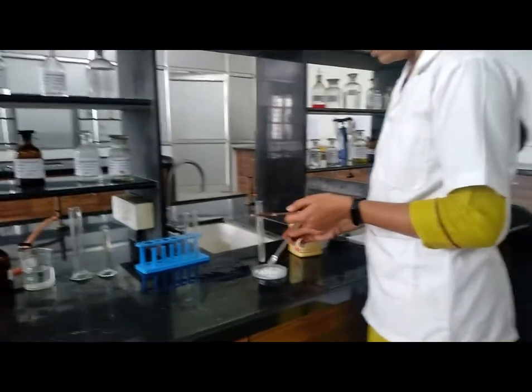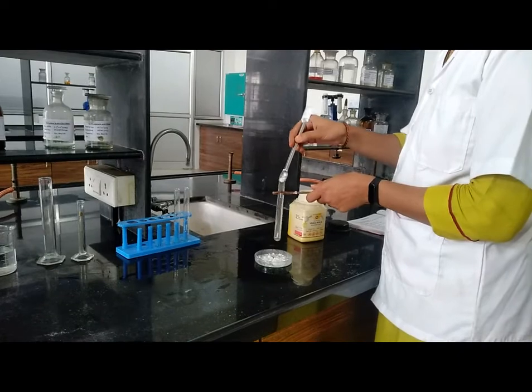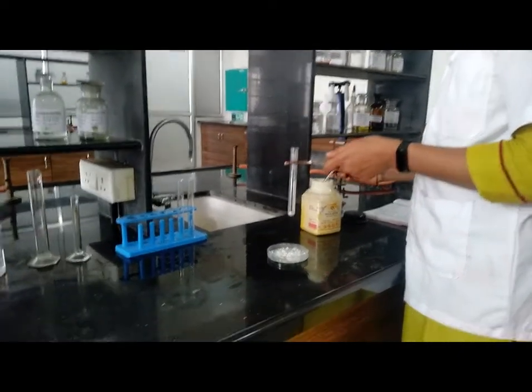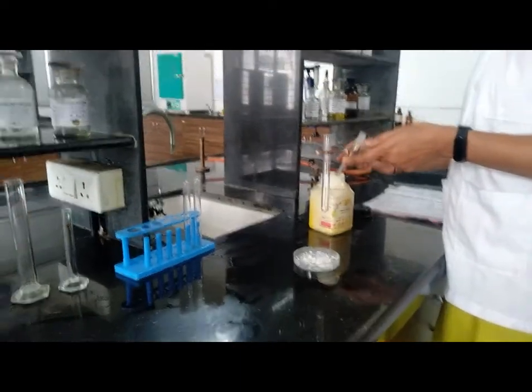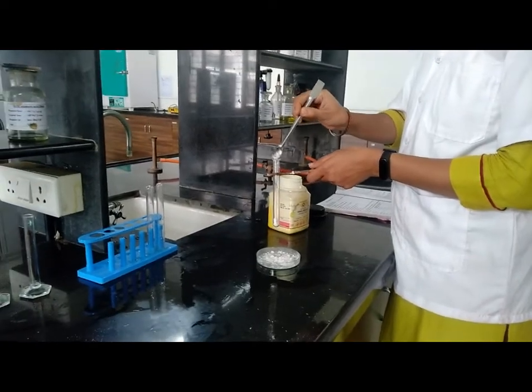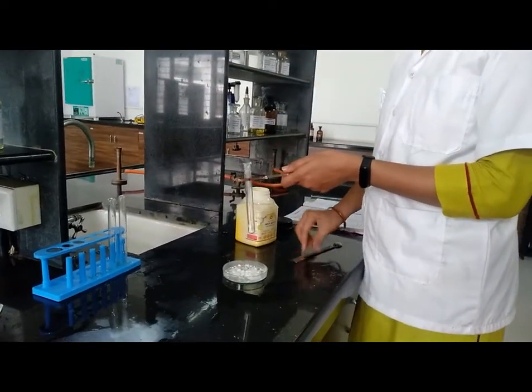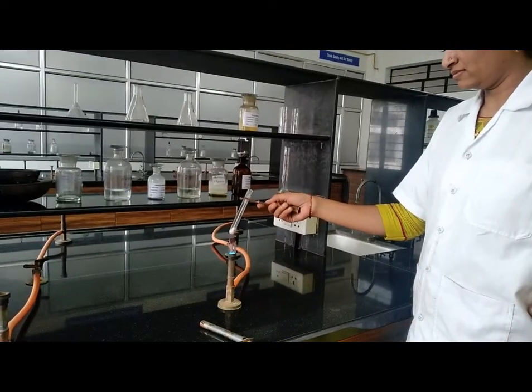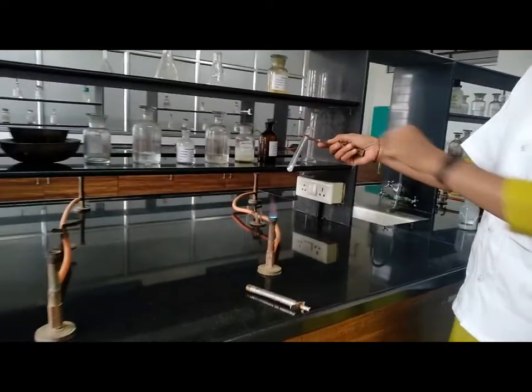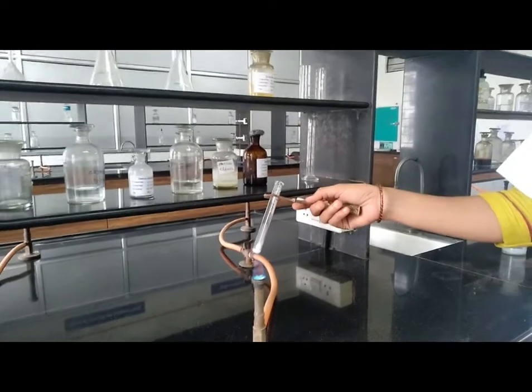Now, identification test: take our sample and add equivalent quantity of dilute acid. Now warm this solution and check the solubility. On heating, there is formation of acidic vapors and the smell of acetic acid.